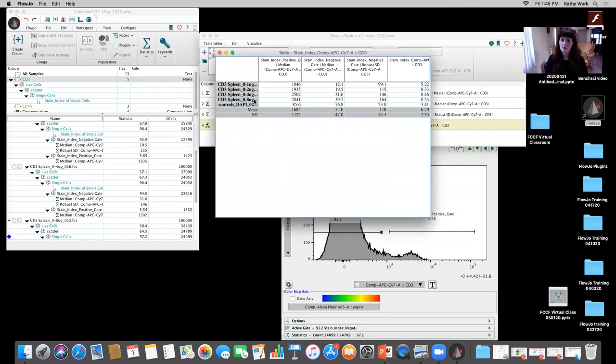And what you can see here, right, is that we have the 0.1 micrograms per mil, 0.2, 0.4, 0.8, and the DAPI, we don't need to analyze that, right? Because it doesn't matter for us. There's no CD3 in there. This is just a higher autofluorescent population it picked up. And what happens is the stain index goes from 5 to 8.3, 8.4, 8.5.